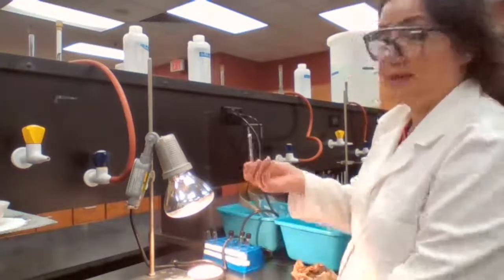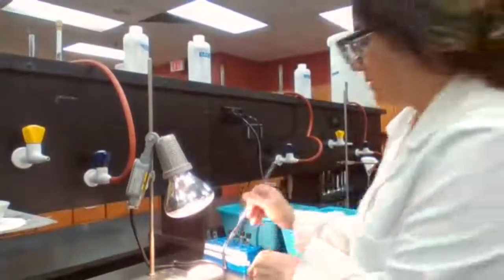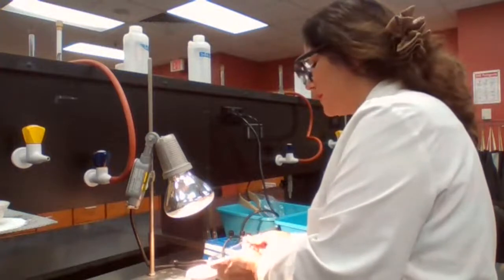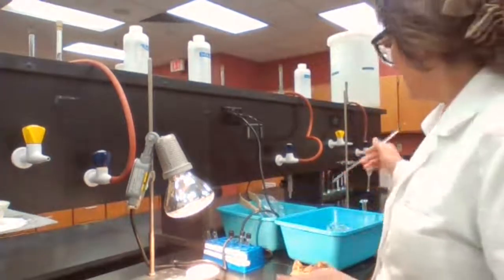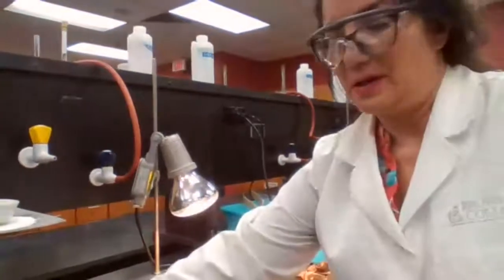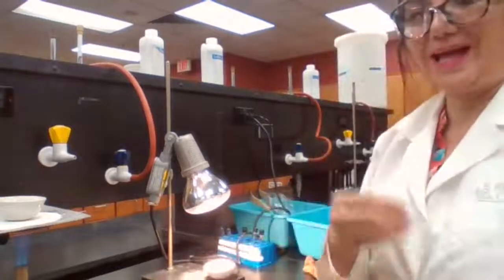I don't want to lose any zinc particle because I touched the zinc with the stirring rod. I have to make sure the pieces are back in the container, in the evaporating dish, because the error for mass here and there can add up. And when it does add up, your numbers are not going to look nice. The numbers are not going to be perfect because these are not made up numbers.